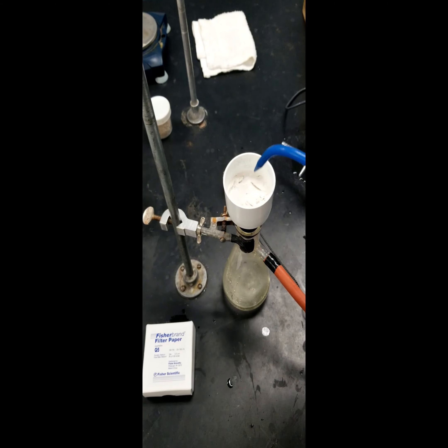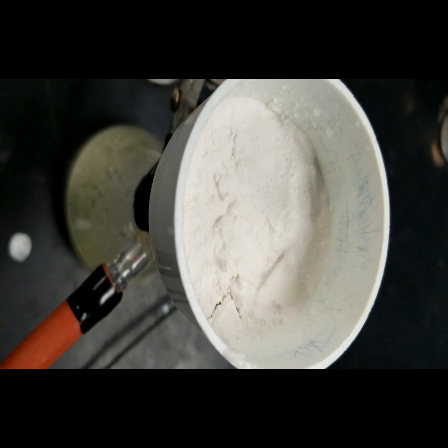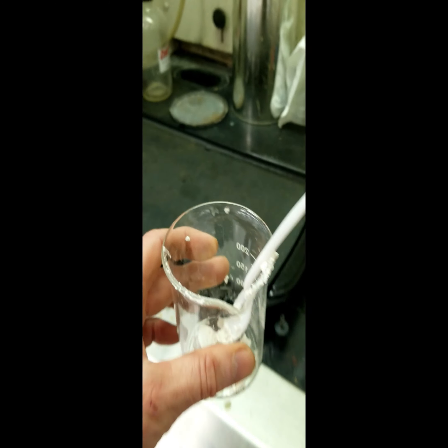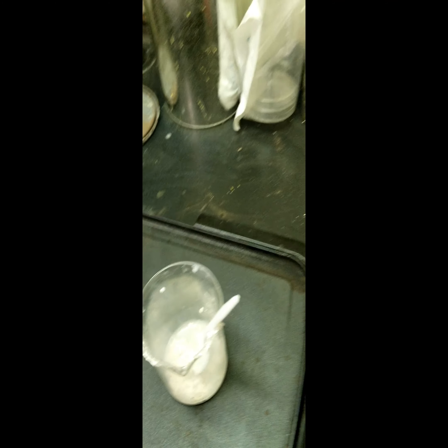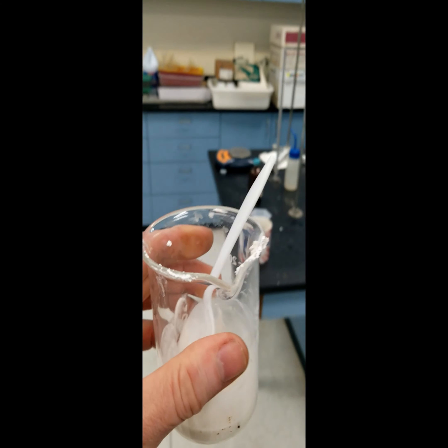Then we need to rinse any excess ammonia from the reaction with more distilled water. Now we're going to transfer the chemical product to a 250-milliliter beaker. In the fume hood, we will add hydrochloric acid to the reaction. The hydrochloric acid will break the acetyl group free from the intermediate and should produce acetic acid. Our sulfanilamide is finished now.